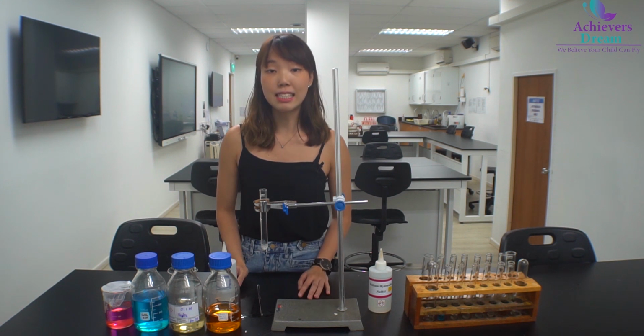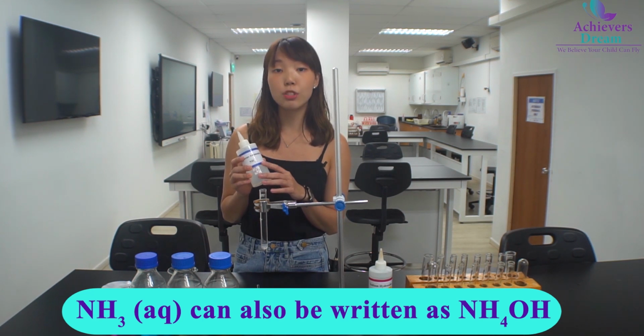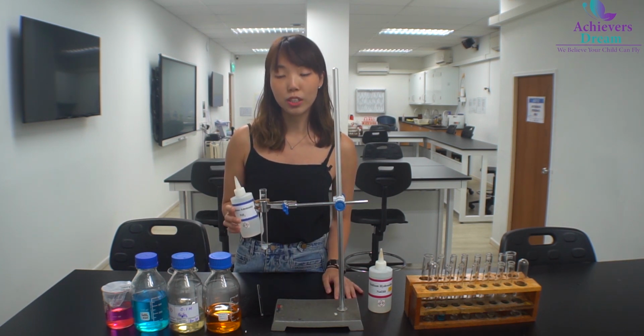This white precipitate is zinc hydroxide. Now, why is it zinc hydroxide? It's because aqueous ammonia can also be written as NH4OH. So the hydroxide ions present in aqueous ammonia reacted with zinc ions to form Zn(OH)2.